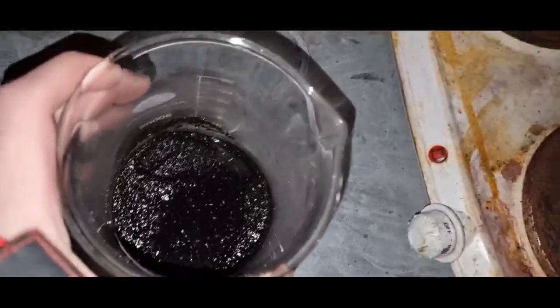Okay, so we're now going to refine this. It's just water in there so far. So the bottom you can see nice gold. The more I mix it about the better it looks but plenty there. It's a large beaker you can see compared to my hands so it's a fair bit.